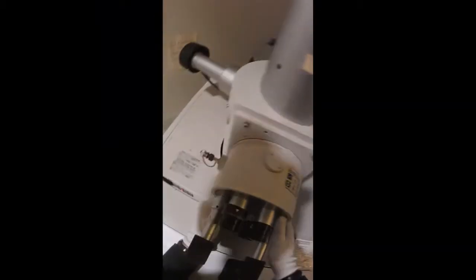We have to make sure that the gasket seals all around to get to the vacuum that we need. So press the evac button now. And hold this, the chamber door, in place.